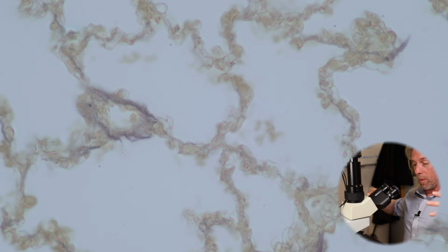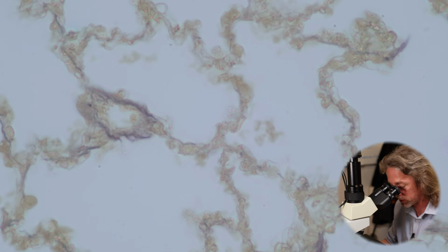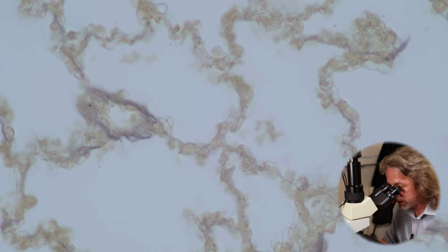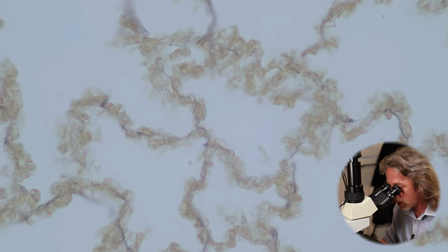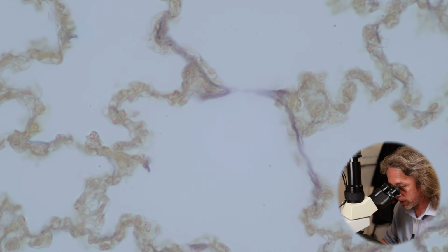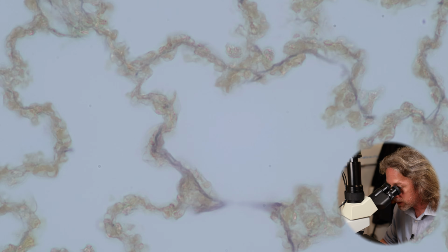We pull air in, and then as we relax the skeletal muscles and relax the diaphragm, all that elastin that you can see there under the microscope was stretched and is now de-stretching, is shortening, and has helped push the air out of the lungs. And all of those factors that we've talked about stop these alveolar walls from collapsing and sticking together.